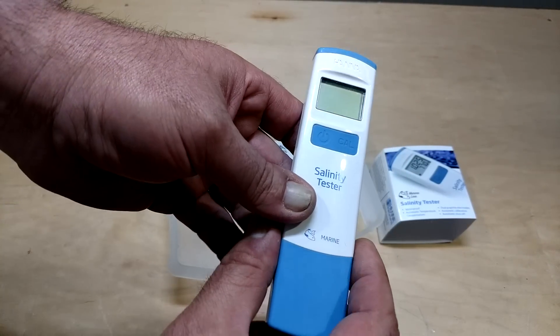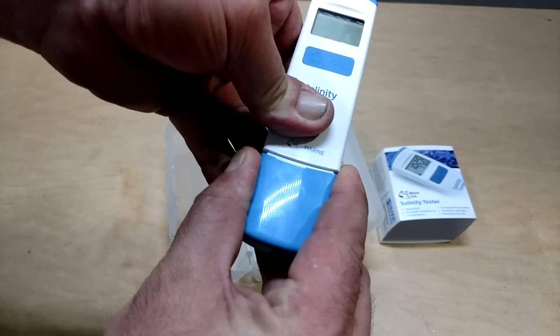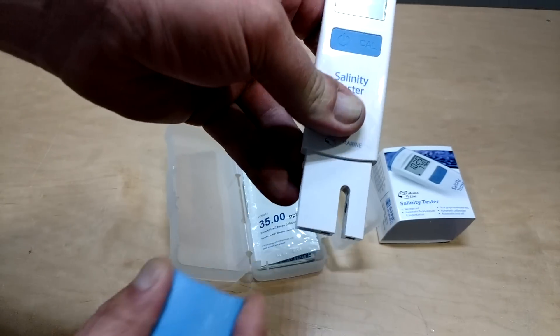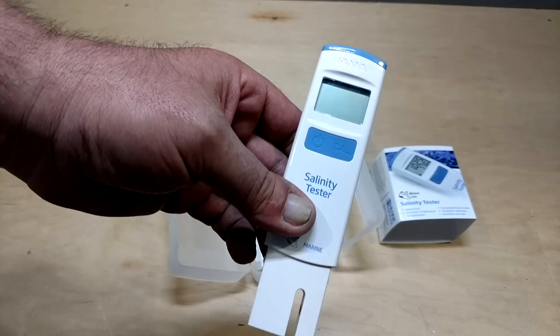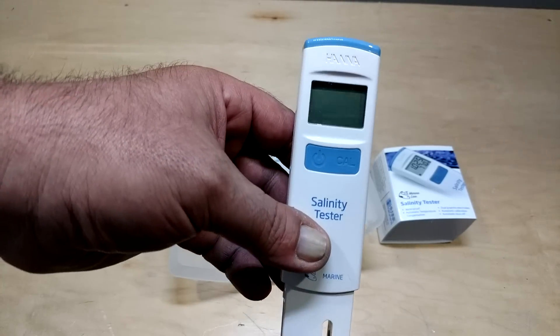So Brian, again, thank you for the recommendation and the same goes for you Fishy. Fishy recommended it and he did a really awesome video. So I'm going to show you guys exactly how easy this is to use. Let's go upstairs and take a look.